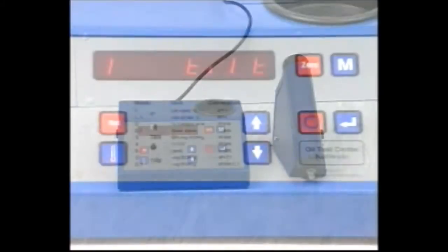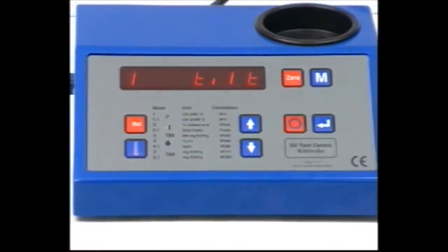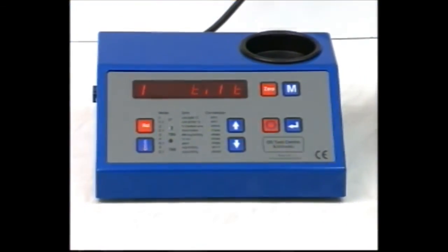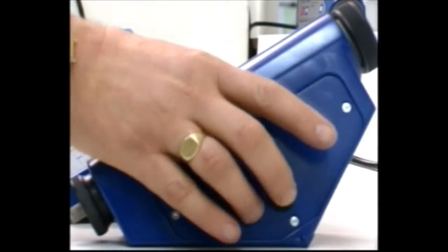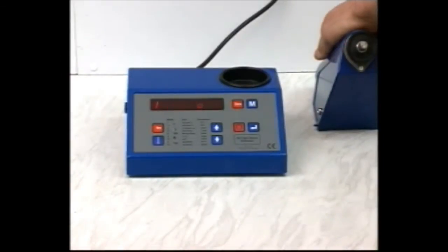Select Mode 1. The display will show Tilt. Press the Power Reset button. Smoothly tilt the viscometer. The display will show the movement of the ball inside.